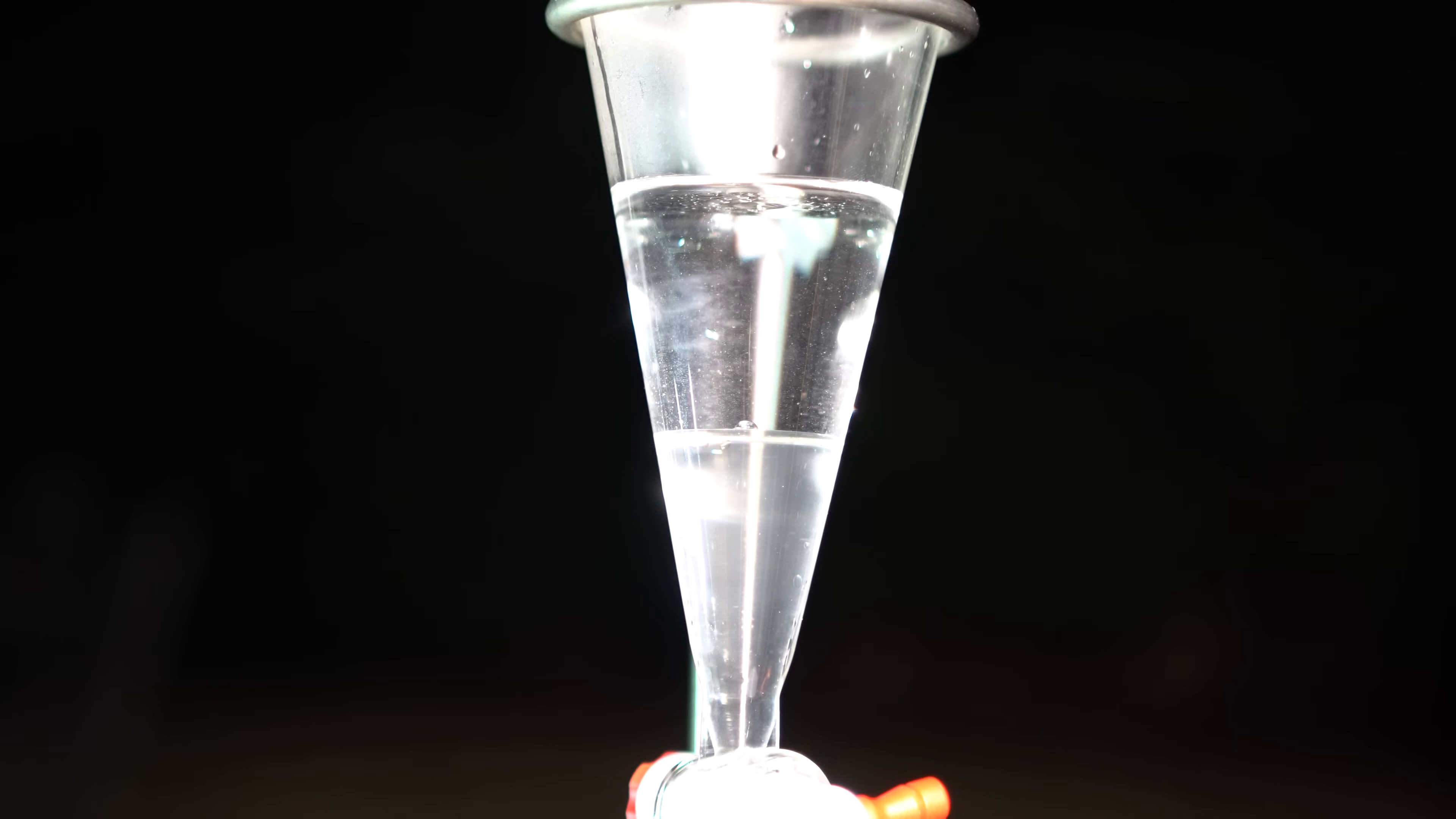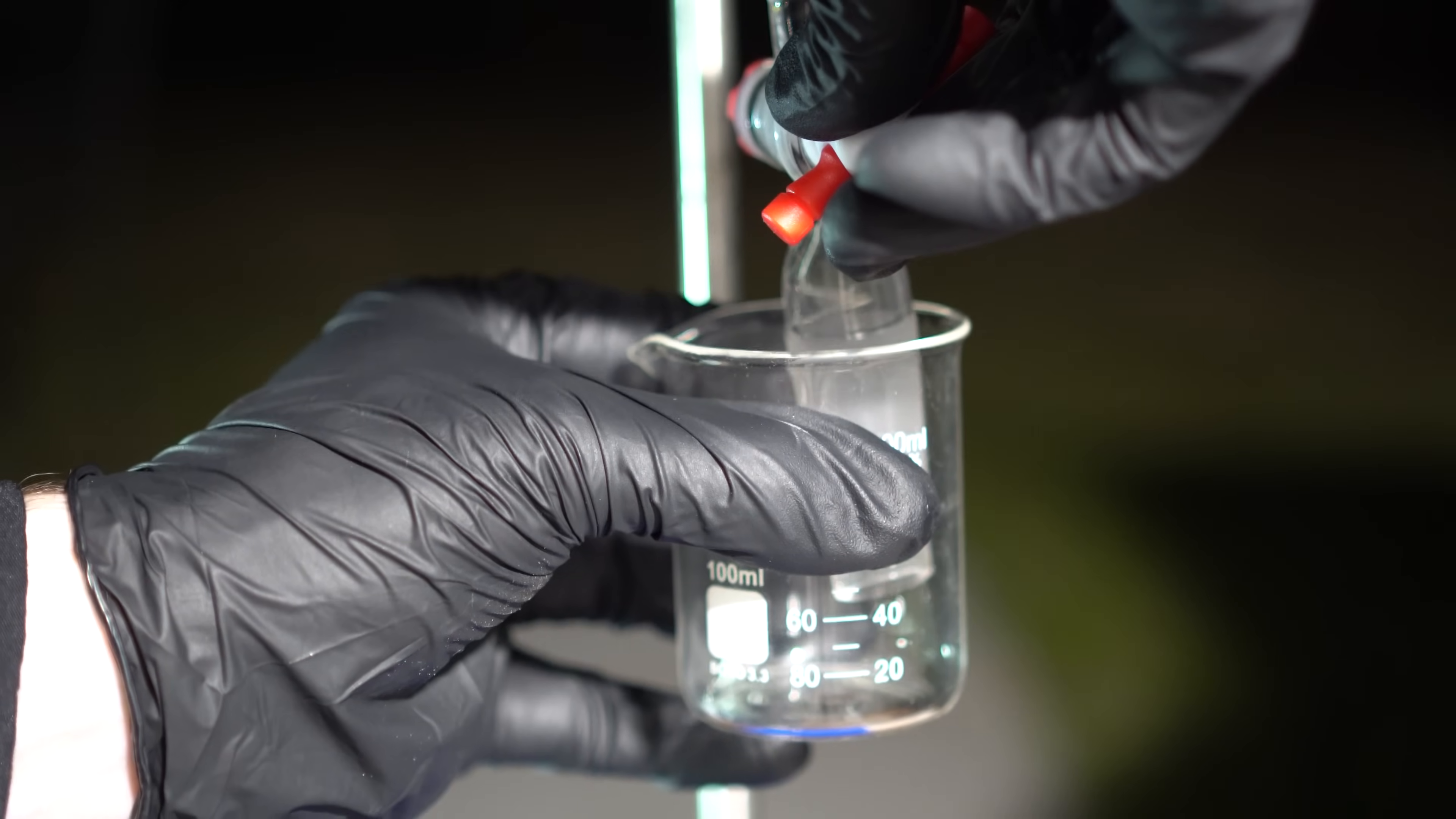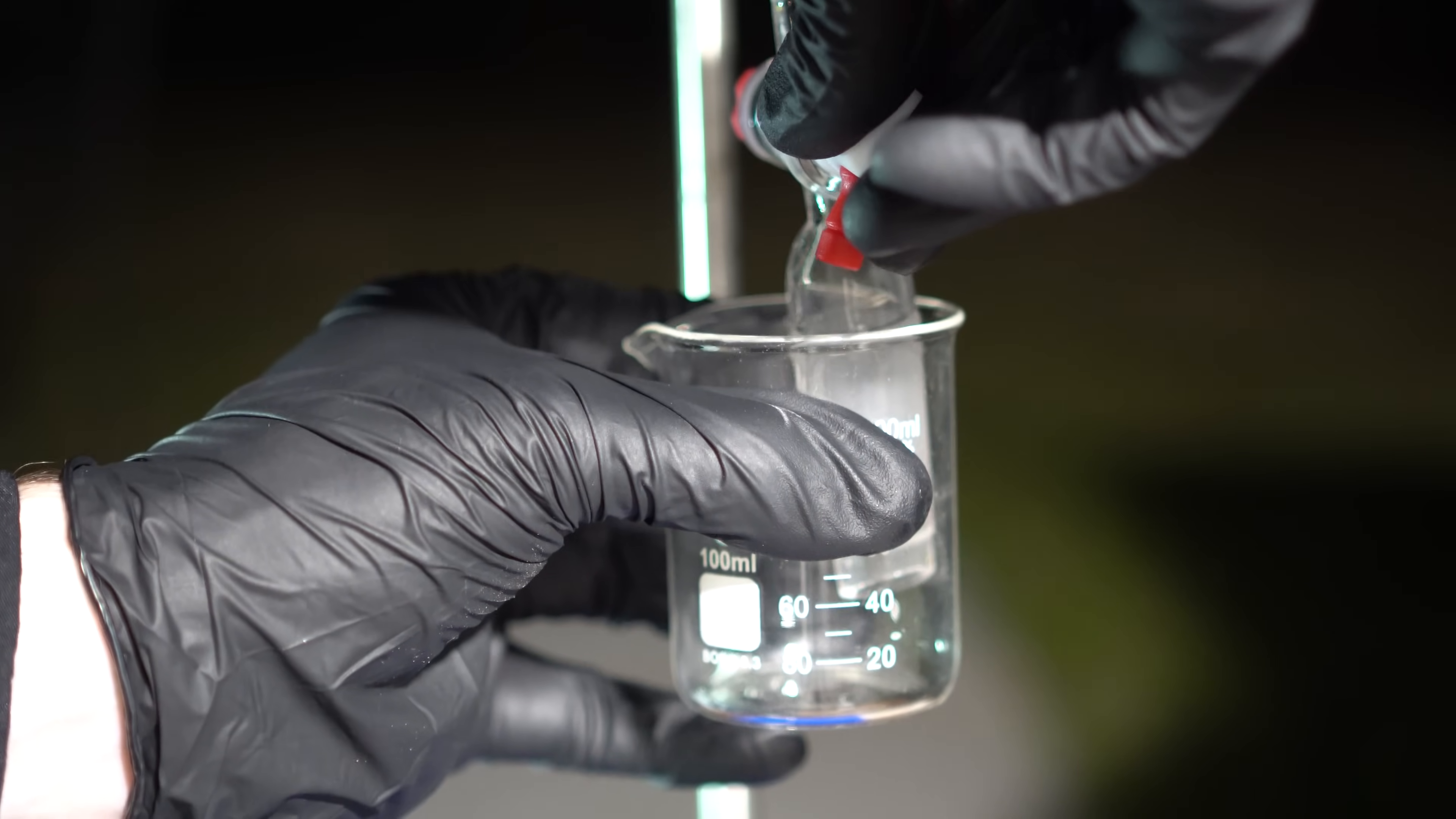This was then repeated two times, and with the bottom layer being saved each time. I had to be careful not to get any on my skin, as I really don't want it on there, and it's kind of toxic. As more and more washes were done, the iodomethane really did start to clear up a lot, and it eventually was pretty much clear.